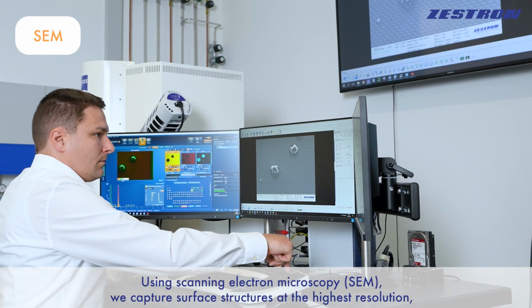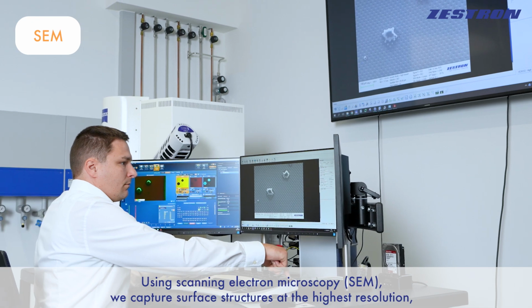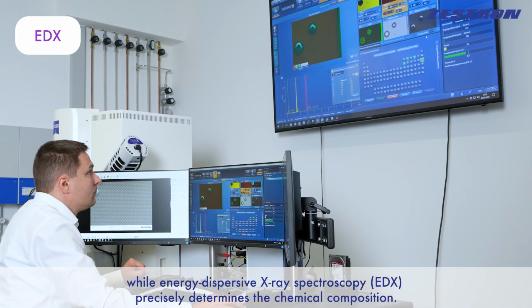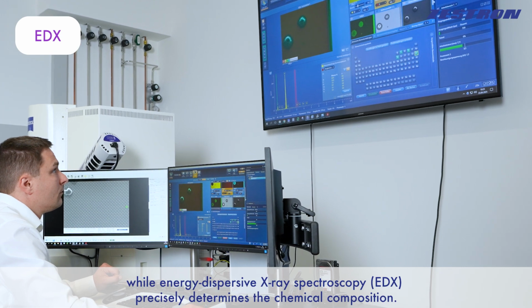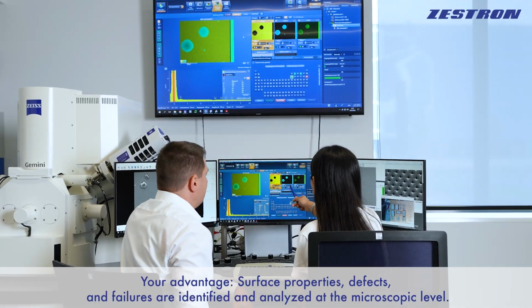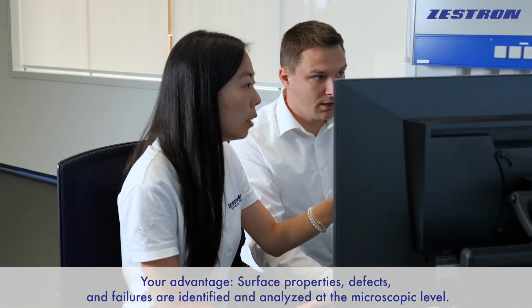Using scanning electron microscopy, SEM, we capture surface structures at the highest resolution, while energy dispersive X-ray spectroscopy, EDX, precisely determines the chemical composition. Your advantage: surface properties, defects, and failures are identified and analyzed at the microscopic level.